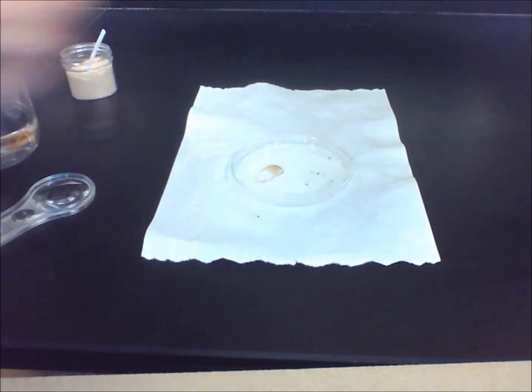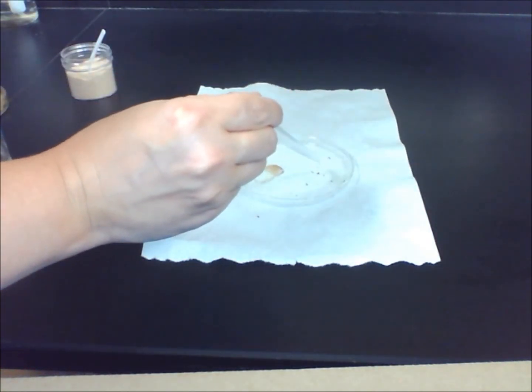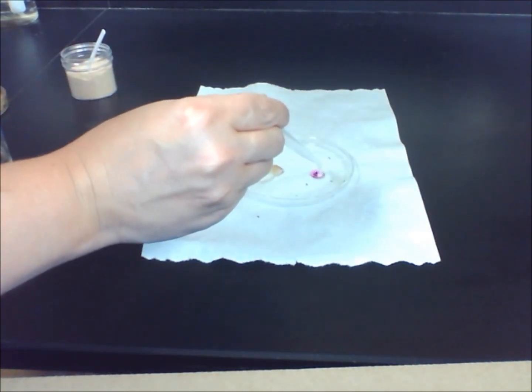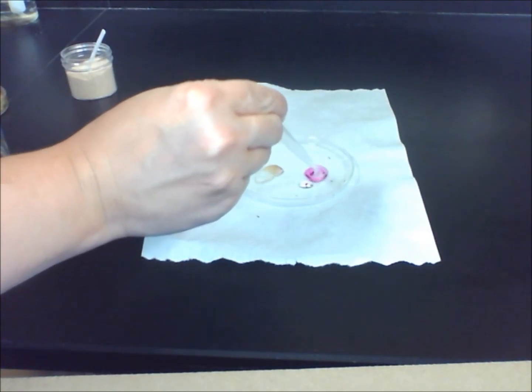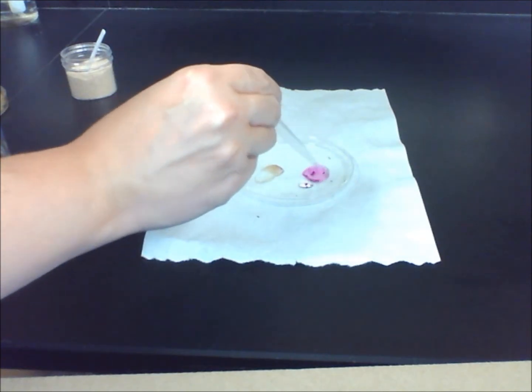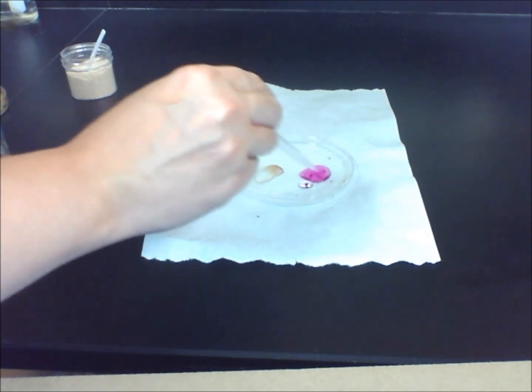Substance B, on the other hand, immediately begins to dissolve. You can tell by the water turning purple and the crystals eventually disappearing.